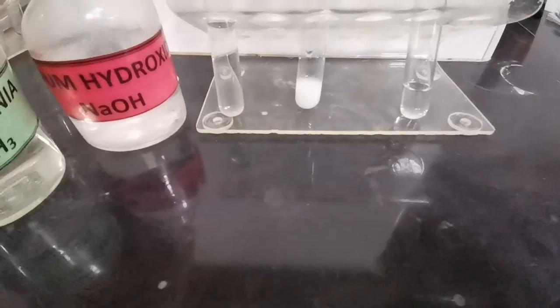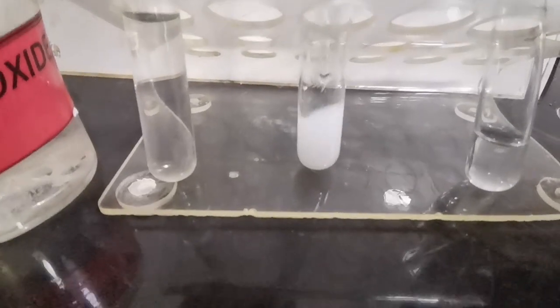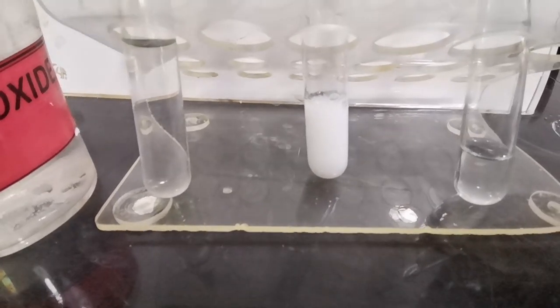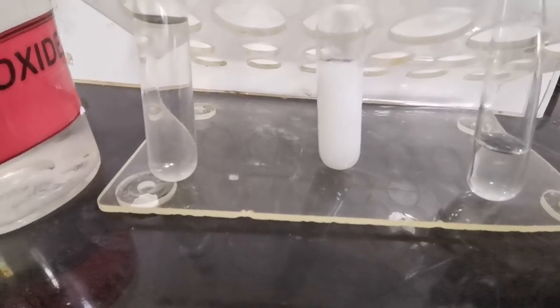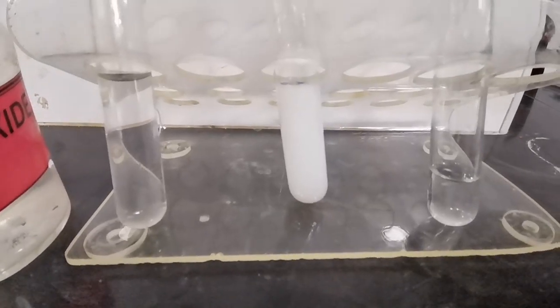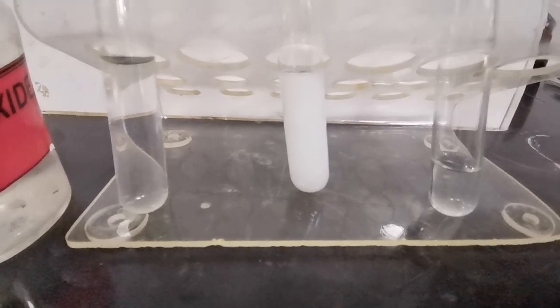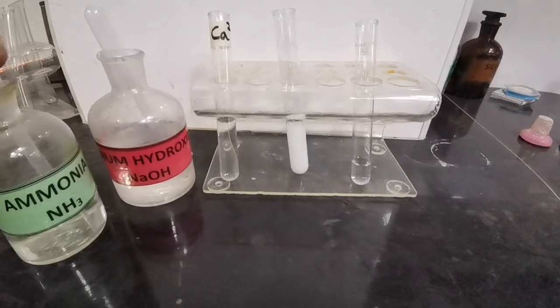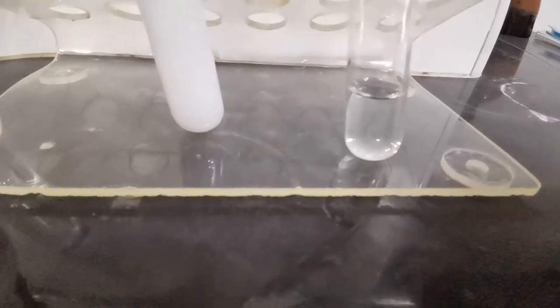Now we are going to add sodium hydroxide in excess and see whether this precipitate remains or dissolves. It is clearly visible that the precipitate is not dissolving. We have formation of a white precipitate with sodium hydroxide upon addition dropwise, and the precipitate does not dissolve on addition of sodium hydroxide in excess. Now we are going to repeat the procedure using ammonia — here we have the clear solution of calcium ions.